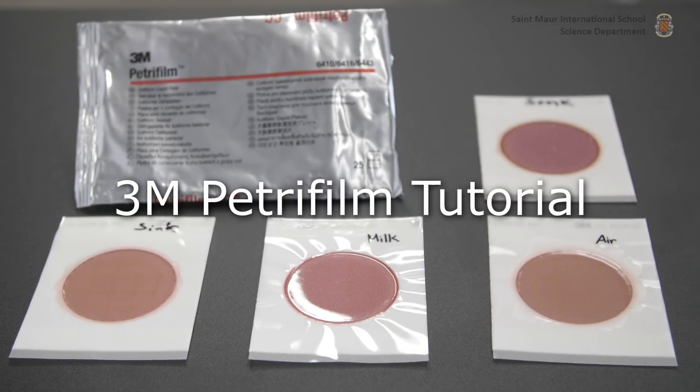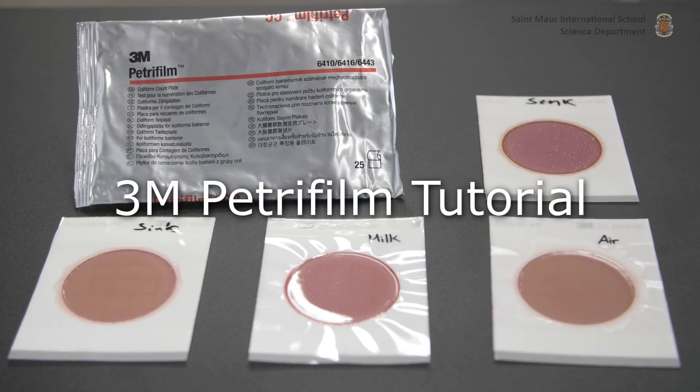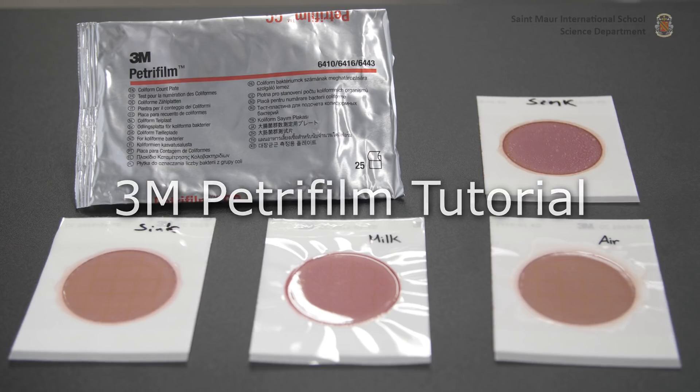We will demonstrate how 3M Petrifilm coliform count plates can be used to quantify coliform contamination.